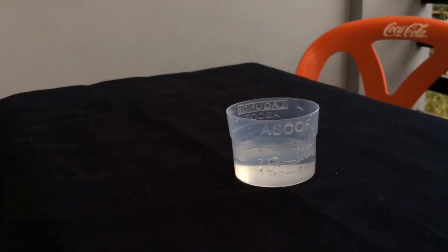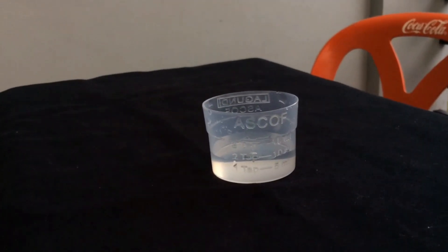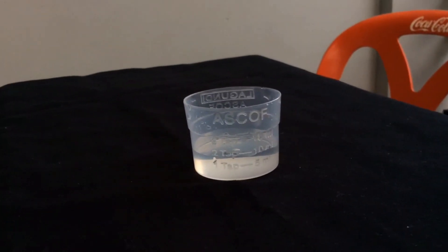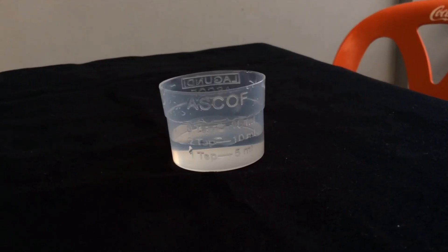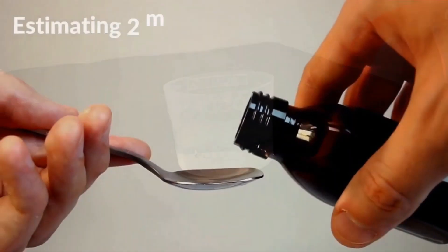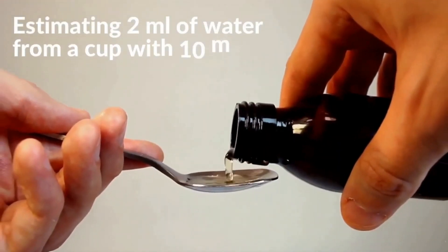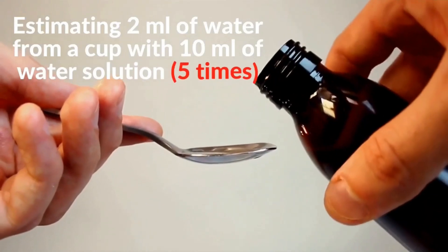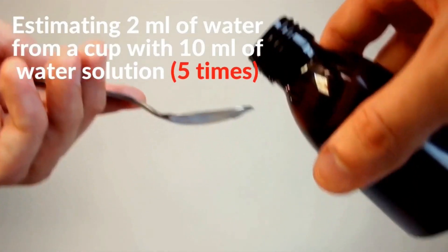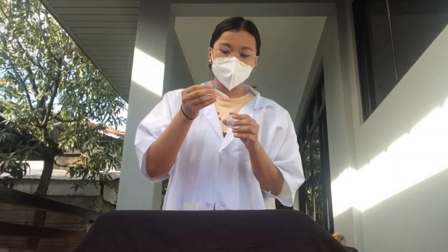And here's the result. Moving on to the next practice, we have to estimate 2 mL of water from a cup with 10 mL of water solution, and we will do this for 5 times.